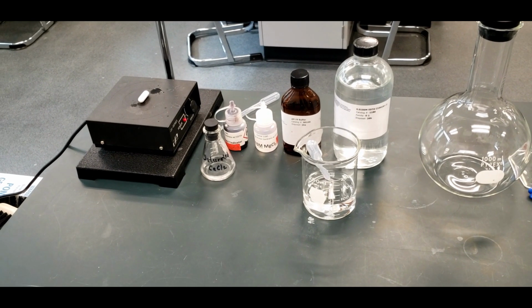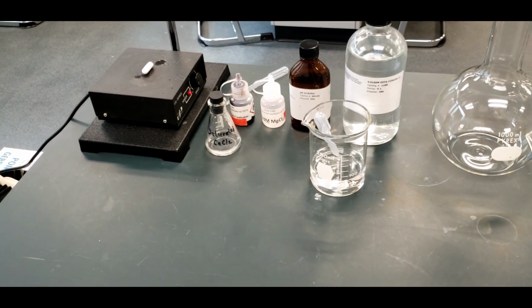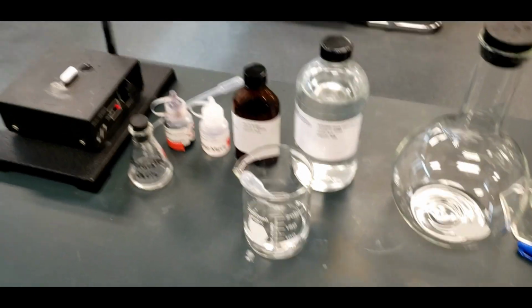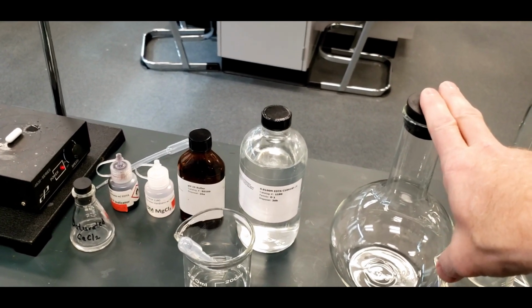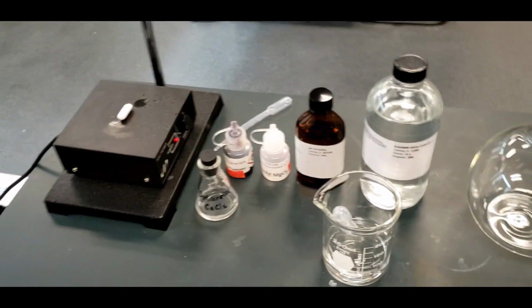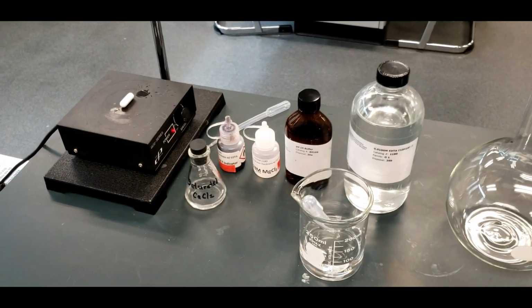This is the determination of solubility product constants lab. And what we're going to be doing is using EDTA to titrate the amount of calcium in a dilute calcium chloride solution. And then we're going to backtrack to what is in a saturated calcium chloride solution and then get our KSP from that. So we got some more titrations to do here.